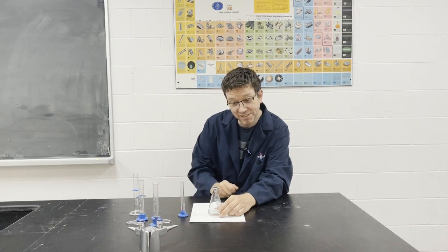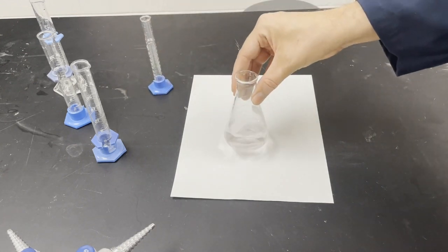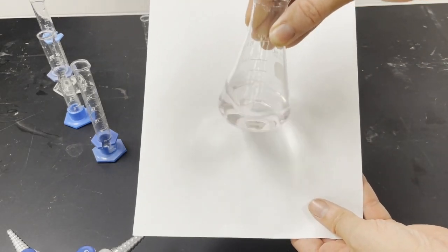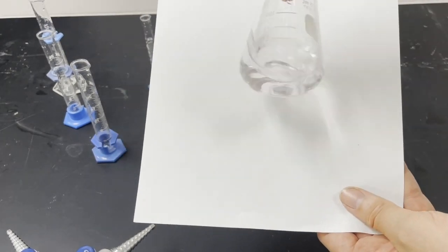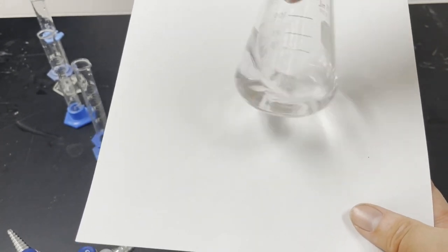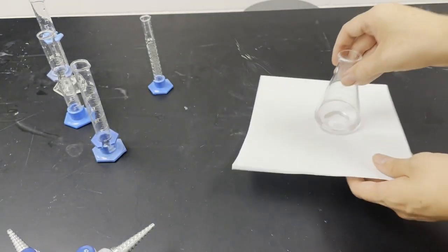All right, come a little closer. I think we're getting pretty close now. All right, what does everyone think? That looks pretty good.